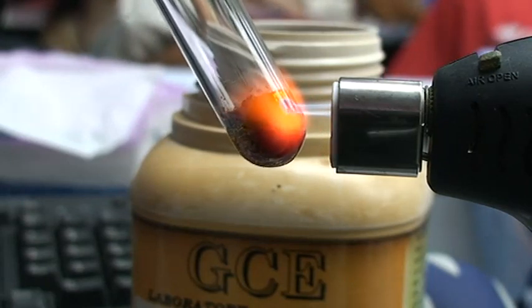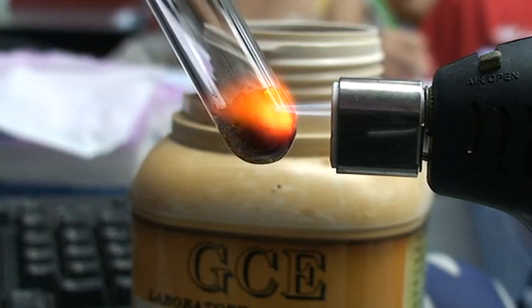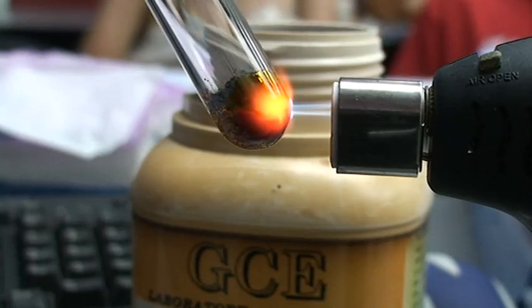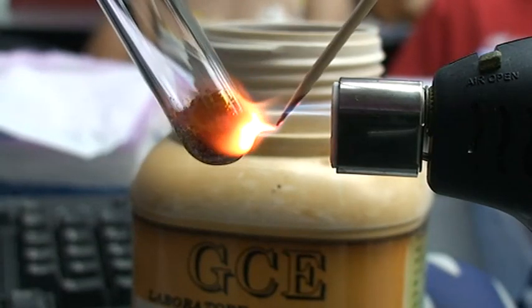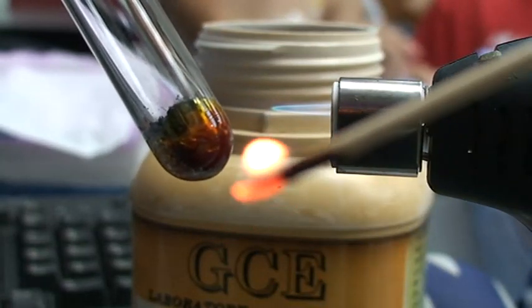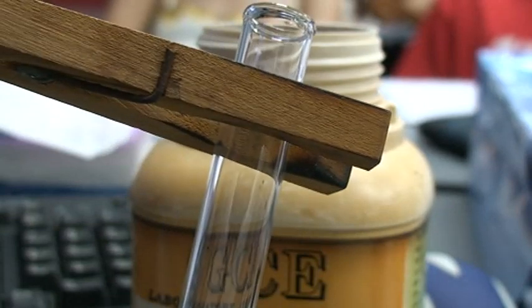There's a reason why I only heat one side of the lead(IV) oxide — because the black powder will turn into two colors. It is actually melting now. I want to test by using a glowing splint. If I use this glowing splint, you can see that it will burst into flame.